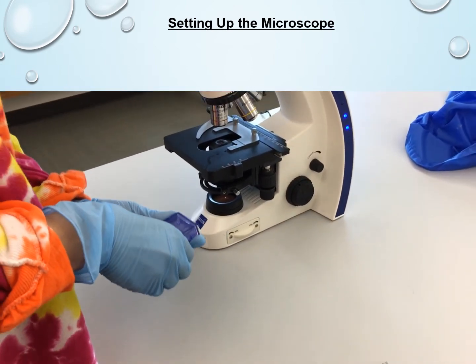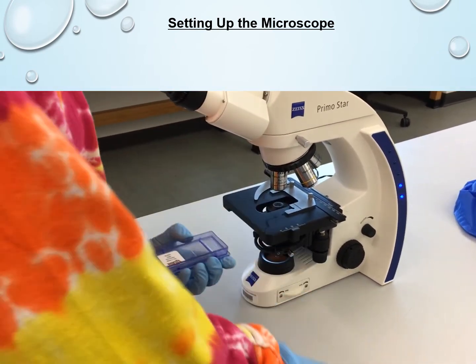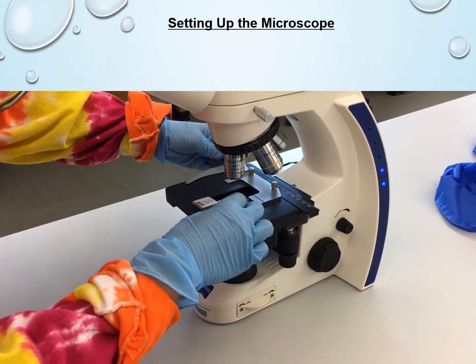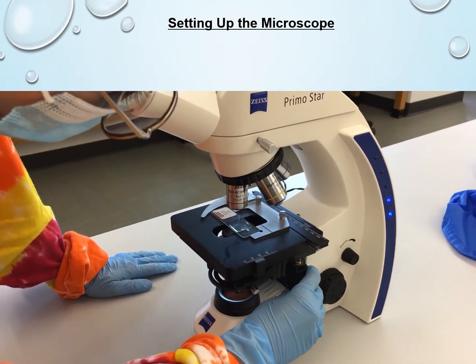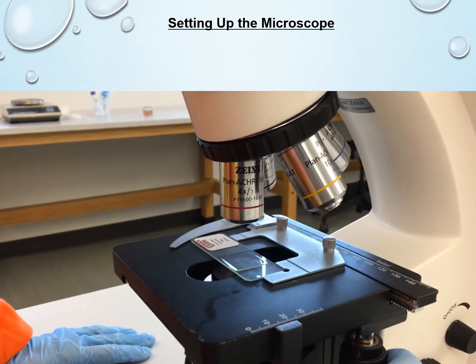So now Emily is taking the micrometer slide just to demonstrate how a slide is positioned. This will be done the same way for any slide that you're using in the lab. And you'll see there's a little lever on the left-hand side that pulls out and allows the slide to be tucked into place. So make sure you don't force that and don't put the slide under the lever, which is a common mistake that students make. It has to fit right next to the lever, and the lever just holds it in place.